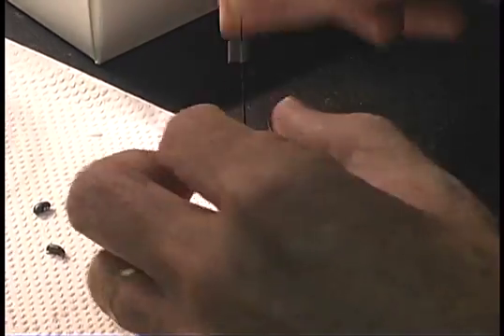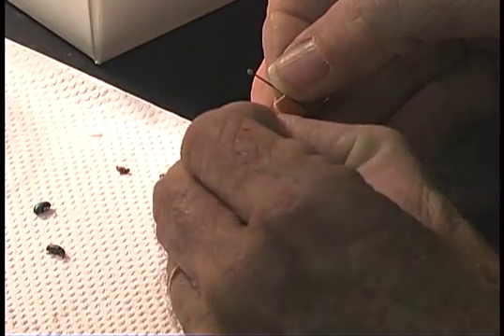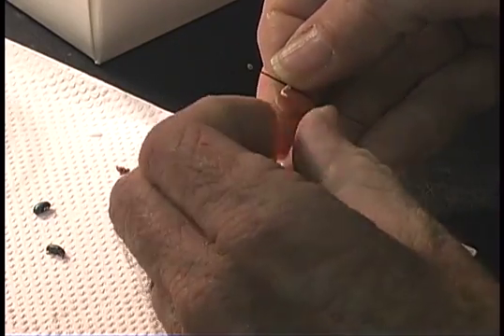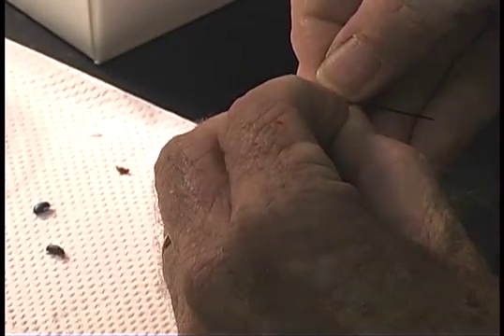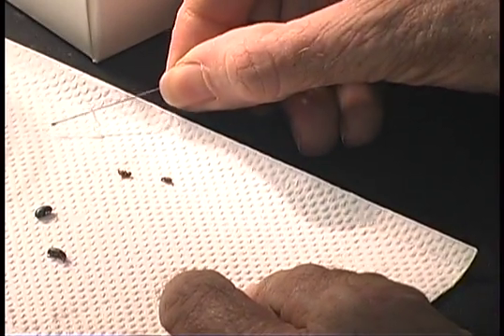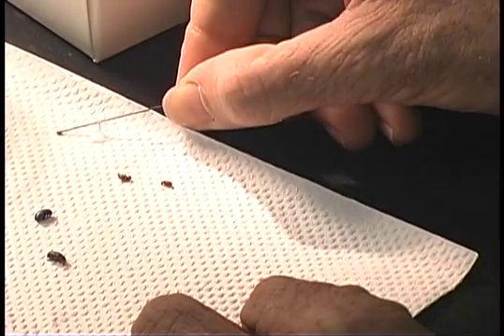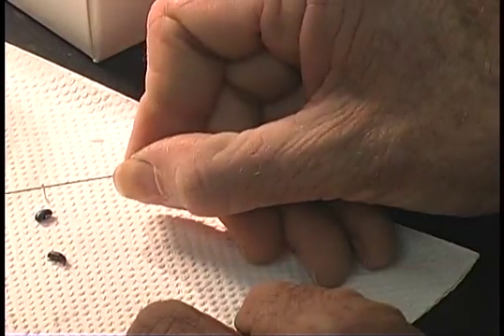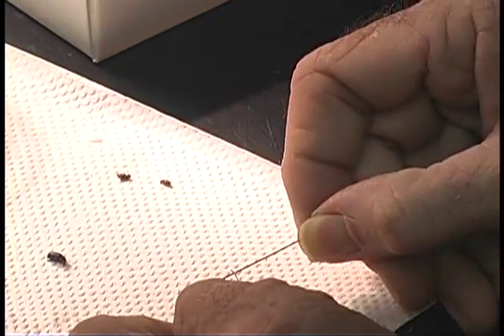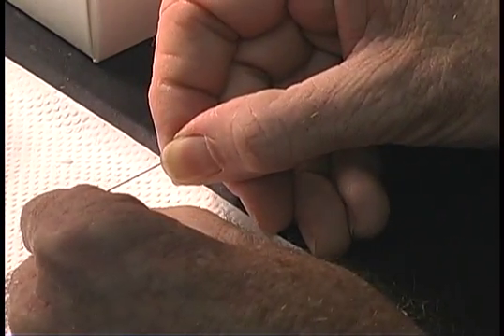When point mounting, the most important thing to keep in consideration is you want to keep the midline of the underside of the insect clear of glue. You don't want to cover that. The insect has only one midline, and if that's covered, you won't be able to see the particular detail that's on the specimen at that part of the body.